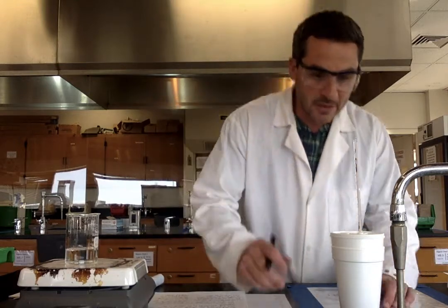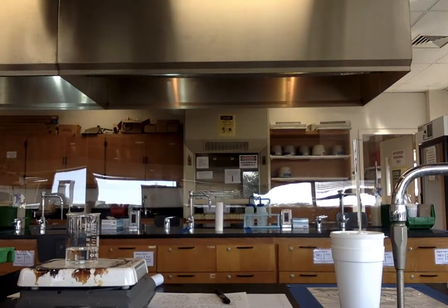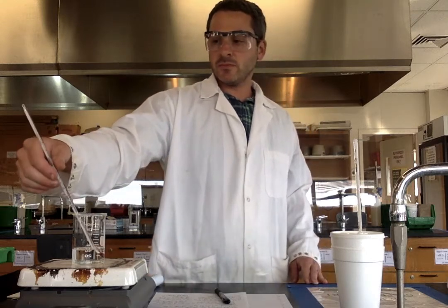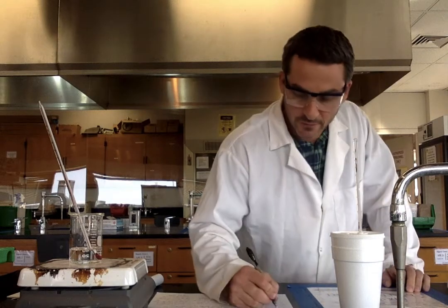All right, so I hit another minute here, and now I'm going to say this is 24.0. It's a little warm today, so it's a little warm in the lab. I don't anticipate it changing very much from there. All right, I'm going to go grab another thermometer for my hot water, and I will be right back. Just to keep an eye on it. Right, we hit the 2-minute mark there, still 24.